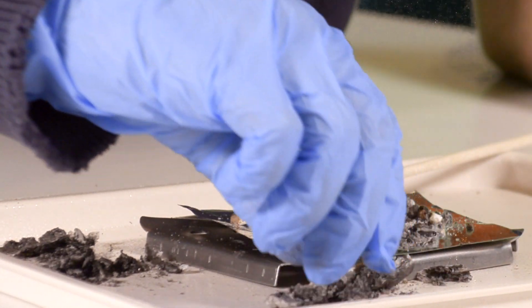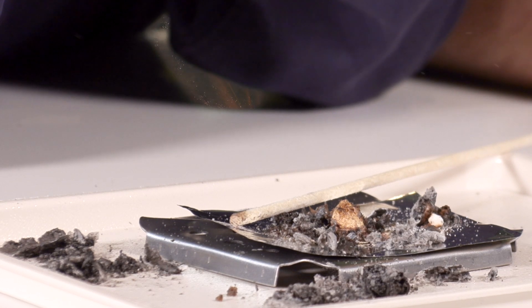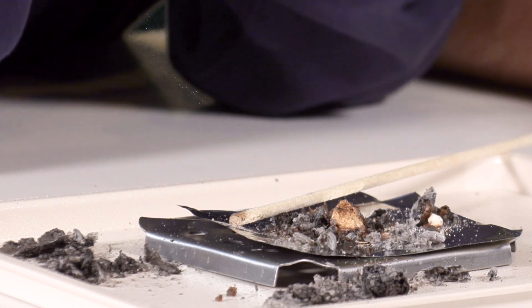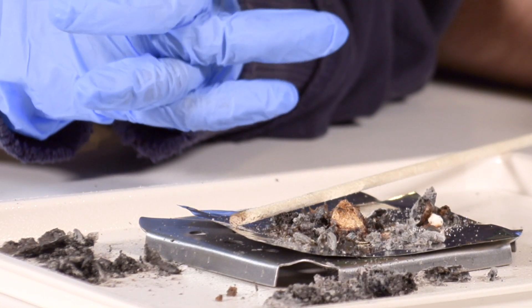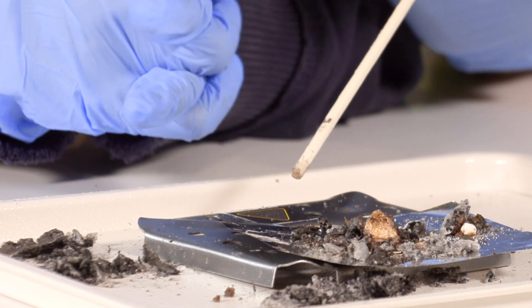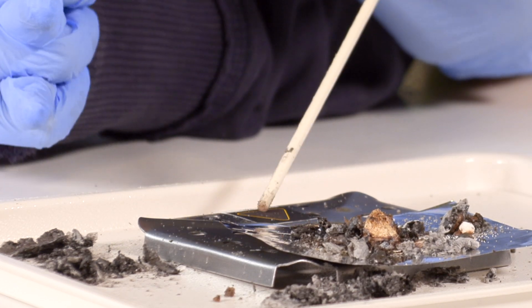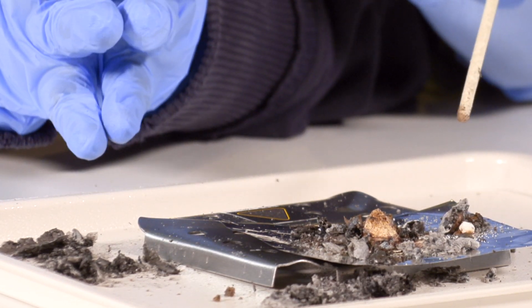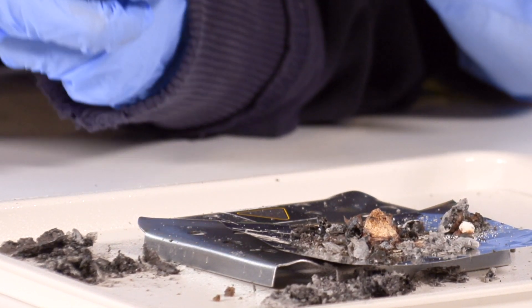The reaction has stopped — it's consumed. It feels like there's still a little bit of that gluconate left, but it's consumed the entire pile of fuel. This stuff is the carbon ash from the gluconate and it just falls right apart. According to the app: when heated, calcium gluconate melts and decomposes, releasing carbon dioxide and water vapor. As a result, foam is formed. It burns, producing solid substances which solidify in the form of a snake. The thermochromic sticker will turn orange when hot and go back to black when not — we did not get the plate very hot because it didn't change colors.